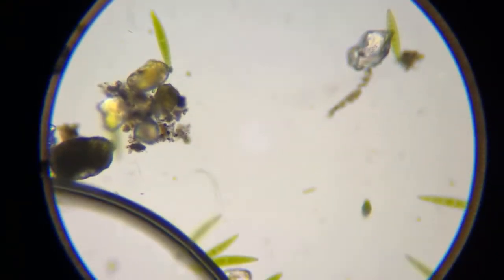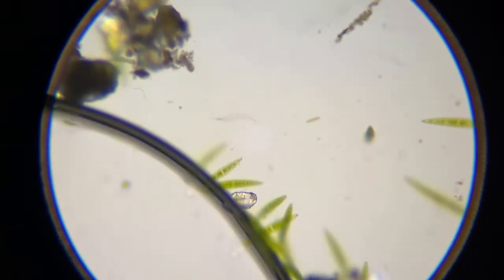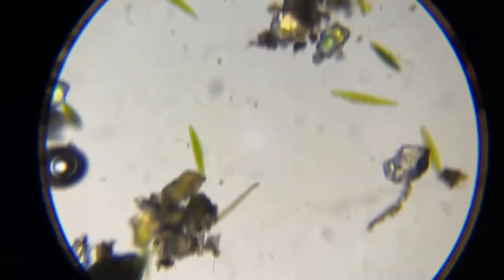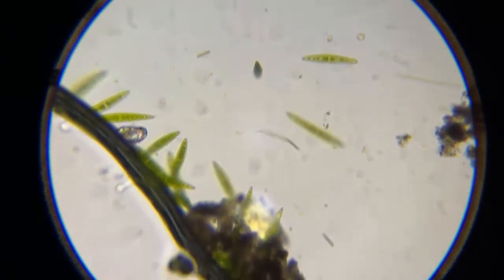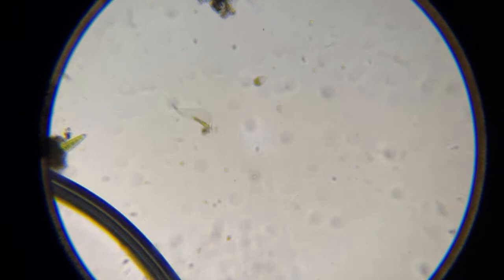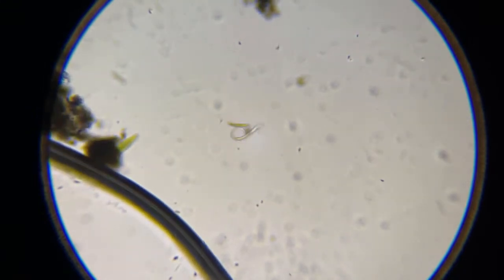And usually, there's the dreaded hookworm. Let's see what he's up to. So that right there is a nematode. Those other worms that you saw are annelids. Most annelids are good guys. Nematodes, like this, are usually rounder, okay? And they have tapered ends, like pinpoint ends. And many of them are parasites like this hookworm right here.